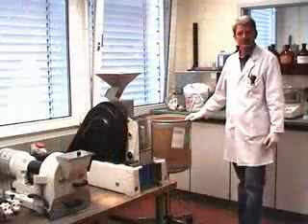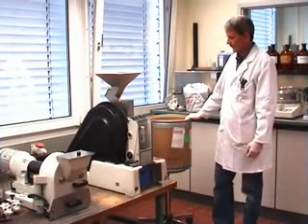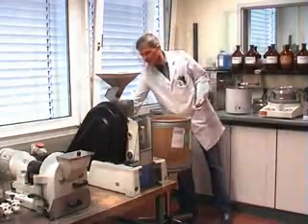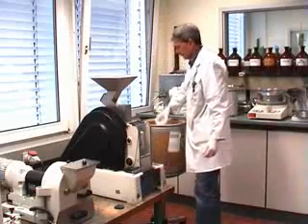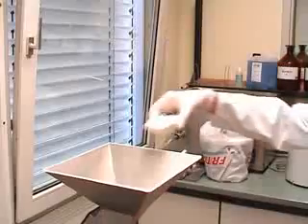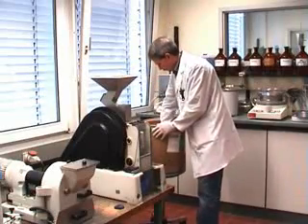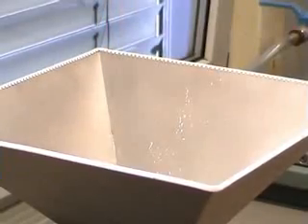Now the test of the sample. The batch volume of the sample is 20 kilograms. We will measure how long it takes to crush this 20 kilogram batch. Uli, please start.